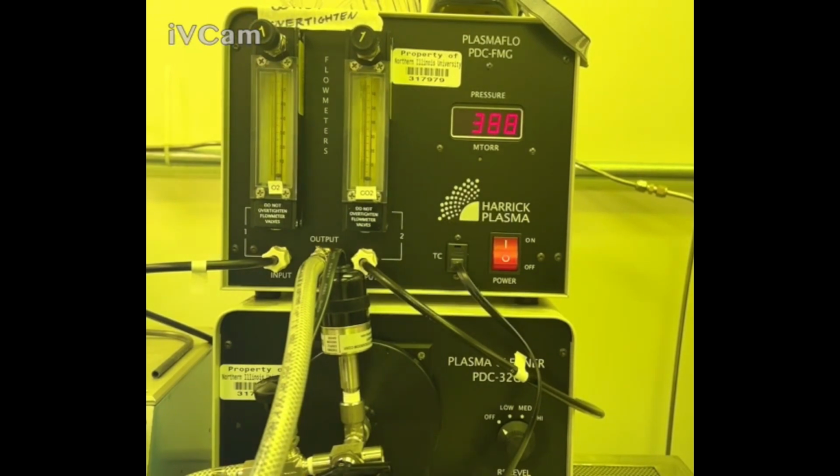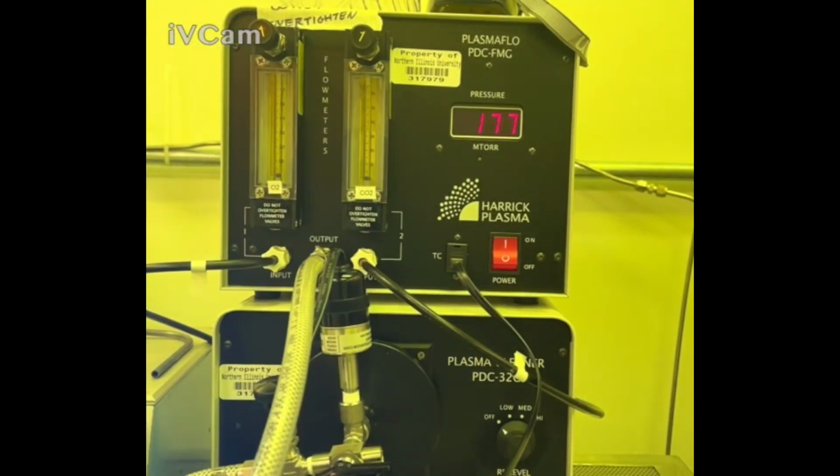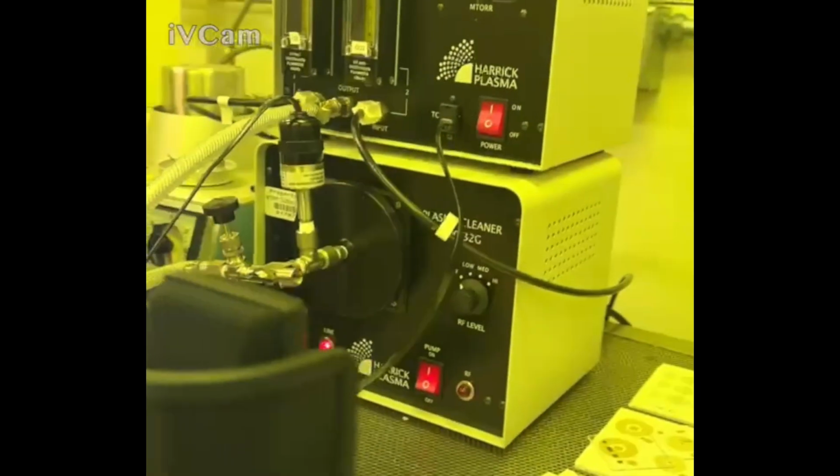Typically what would happen is you would flood this at maximum for 2 minutes, and then you would bring it down to 3 SCCM and another 2 minutes. Once that's done, you completely close the valve. Again, don't over tighten it. And then what you're going to do next is come to either side of the opening of the plasma treatment machine. You have a graded section there.